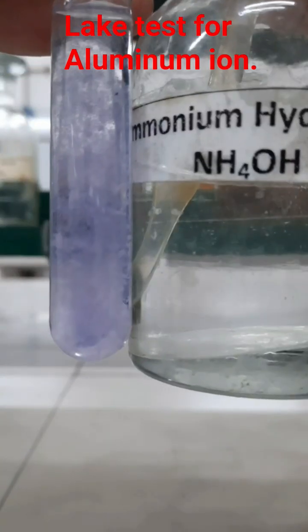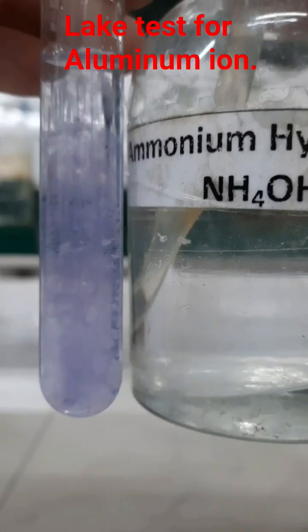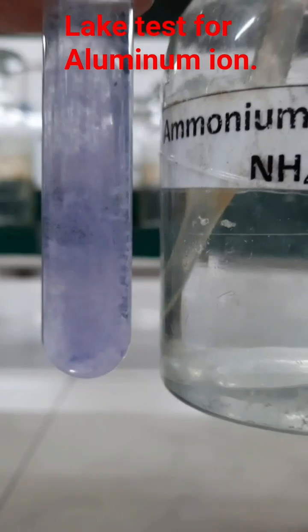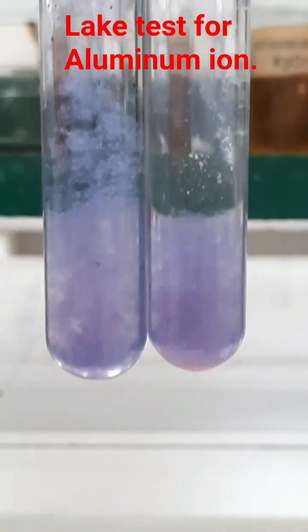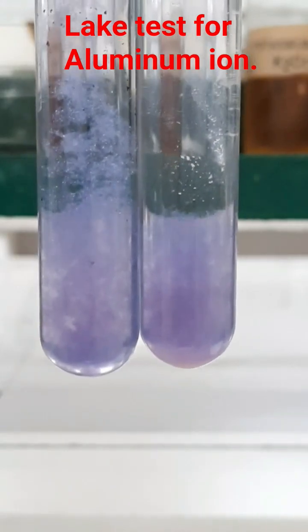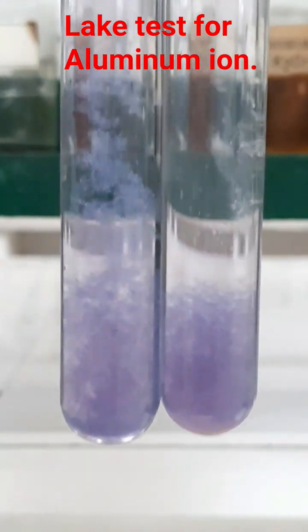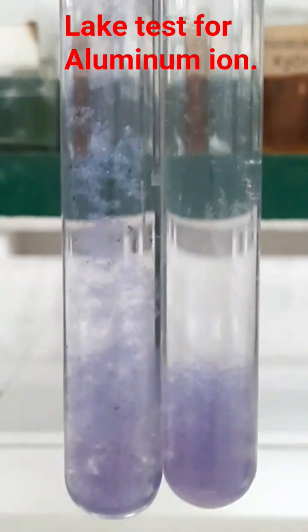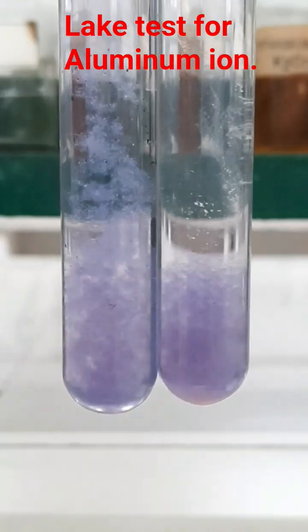This blue floating precipitate, gelatinous precipitate, will give the appearance of a blue floating lake. That is why it is known as the lake test.